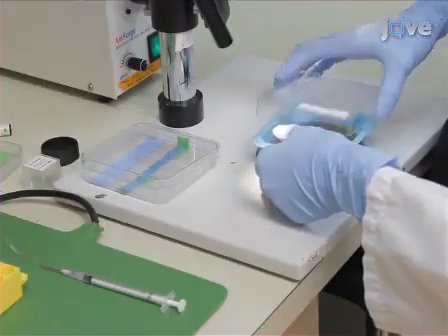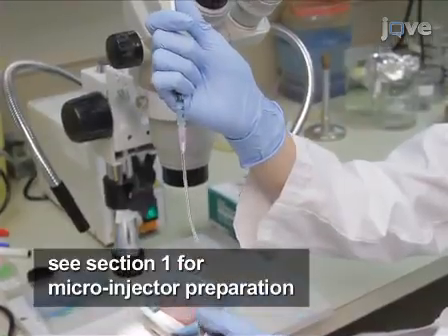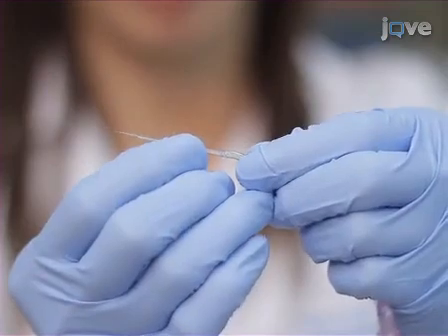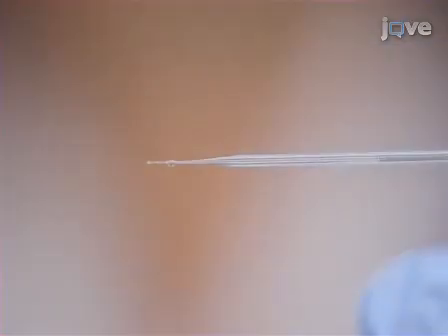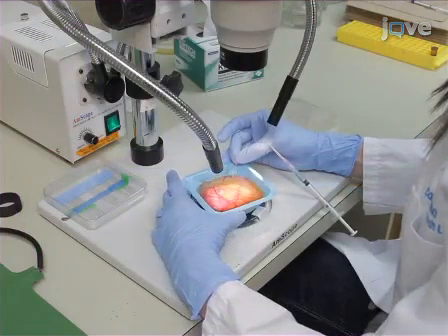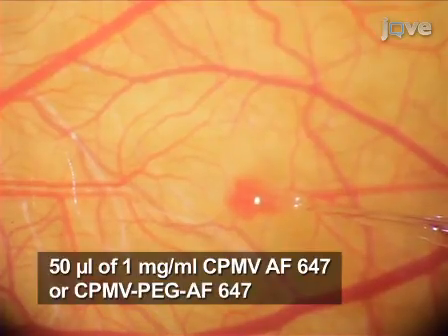Once the embryos have been selected, use a prepared microinjector to draw at least 200 microliters of the prepared nanoparticles. Invert the syringe, carefully tap the side, and depress the plunger to remove any air bubbles. Now, insert a long, tapered glass microinjection needle into the end of the tubing and depress the plunger until the nanoparticle solution reaches the tip of the needle. A blunt needle will not pierce through the ectoderm, and an overly sharp and thin needle will break when inserted into the tissue. Next, intravenously inject between 30 and 200 microliters of nanoparticles into embryos distal from the desired site to be visualized.